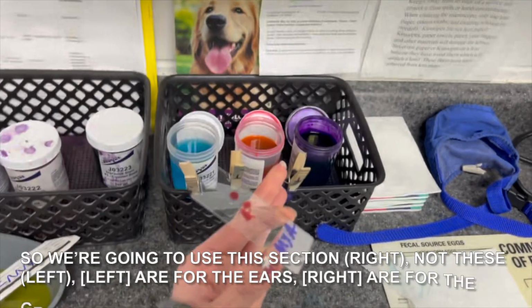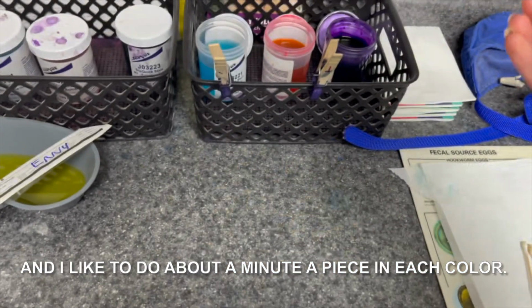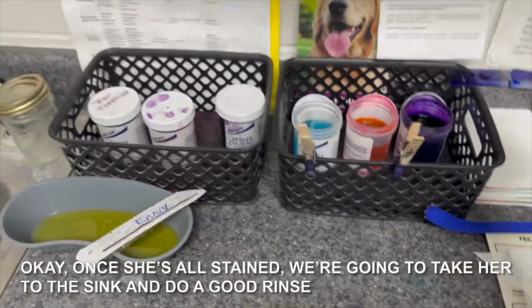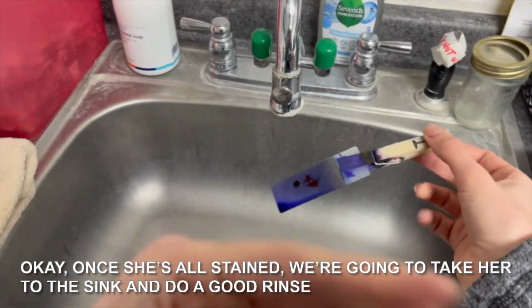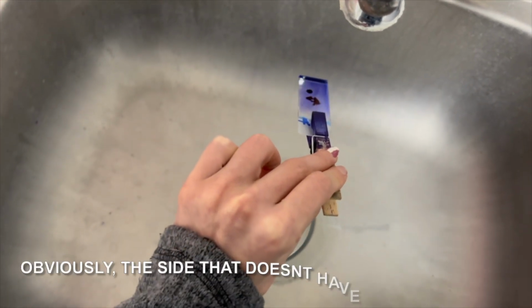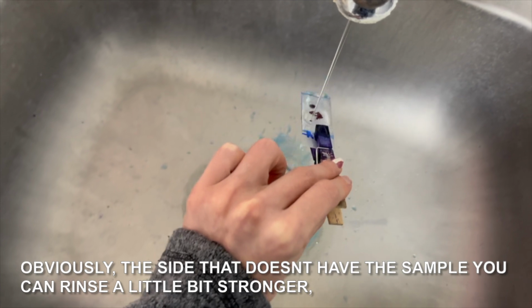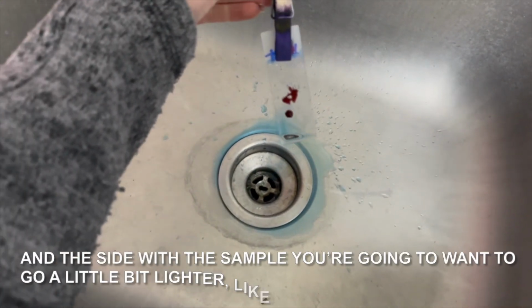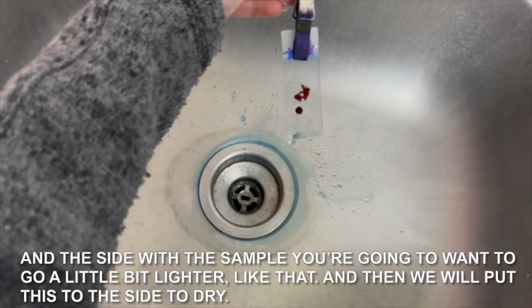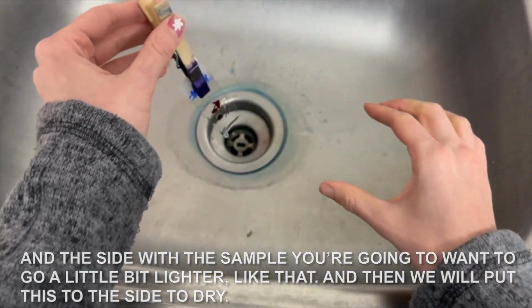So we're gonna use this section, not these. These are for the ears, these are for the growths. And I like to do about a minute a piece in each color. Okay, once she's all stained, we're gonna take her to the sink and do a good rinse. Obviously the side that doesn't have the sample, you can rinse a little bit stronger. And then the side with the sample, you want to go a little bit lighter. Like that. And then we will put this to the side to dry.